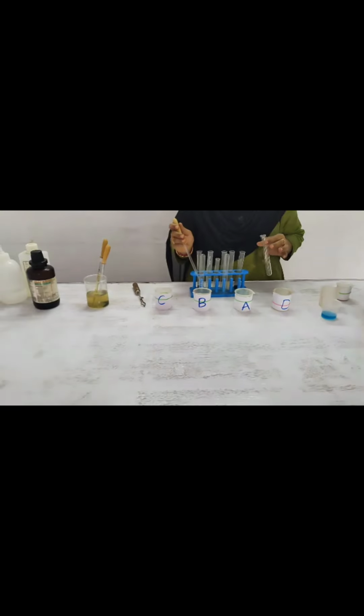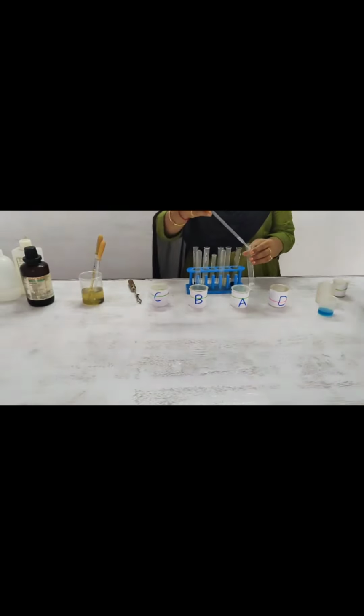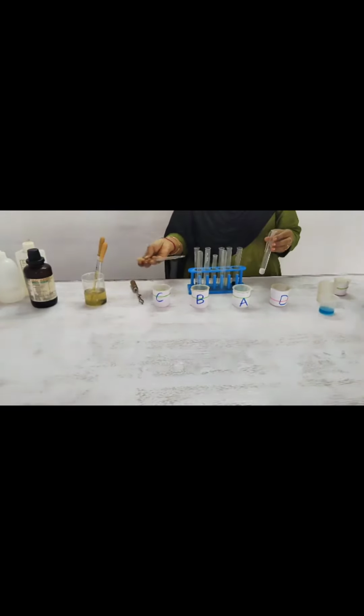Identification of the presence of glucose in a given sample. So in that we have 4 different types of solutions A, B, C, D, and we take the 4 solutions into 4 test tubes. So I will show one sample here, and we have to take the sample into the test tube, in any one of the beakers. And to know the glucose presence, we have to add the Benedict reagent to the sample.